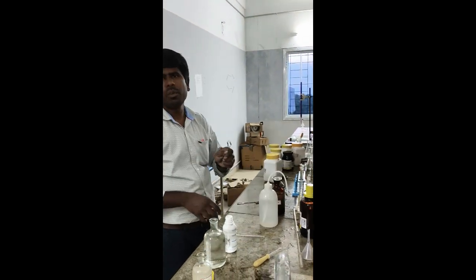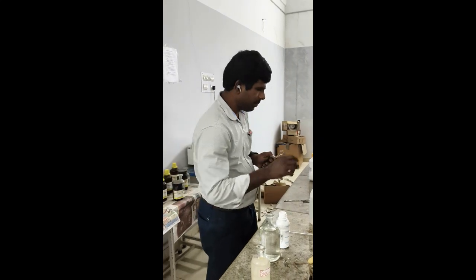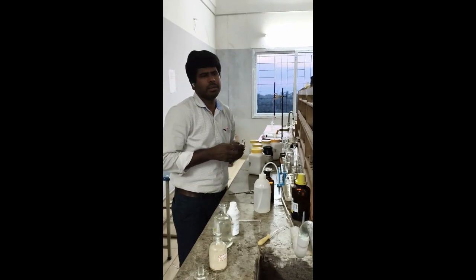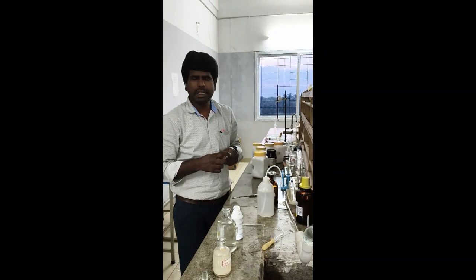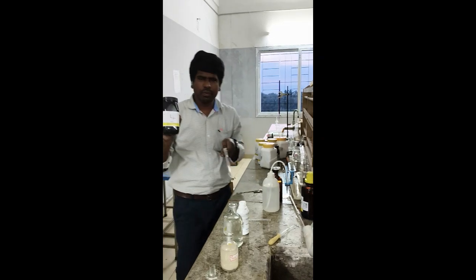So now we confirmed both calcium and carbonate separately. So our salt is calcium carbonate. Okay, next, the fourth salt, aluminium nitrate. So salt number 4.